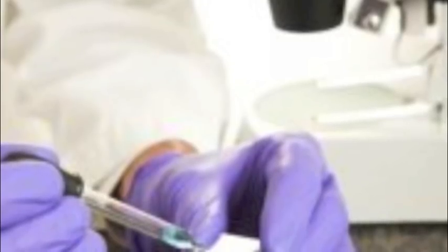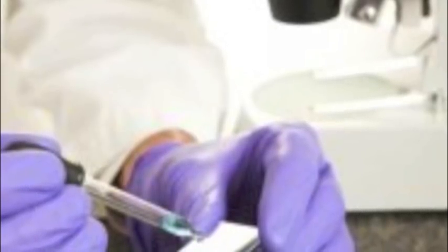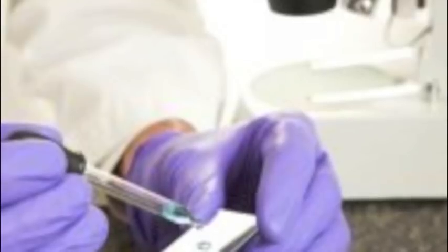Another type of slide is called a wet mount slide. Wet mount slides are made right when you need to use them. These often contain live specimens or freshly collected ones. Since we'll be using both types in class you'll need to learn how to make a wet mount slide with ease.